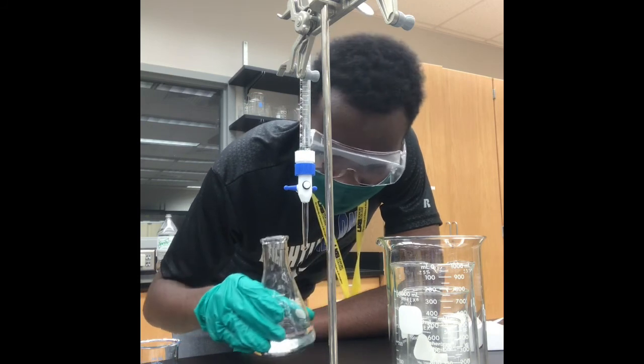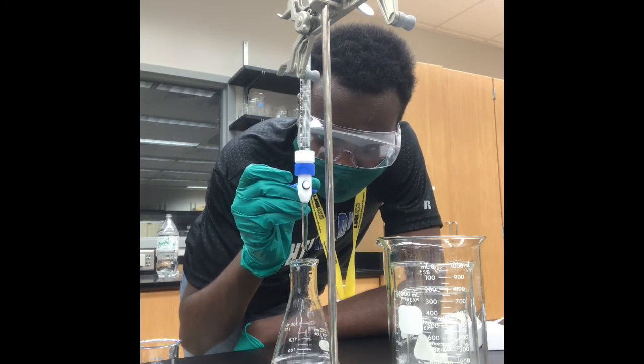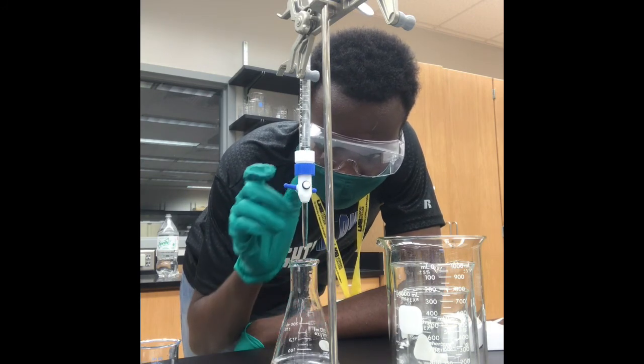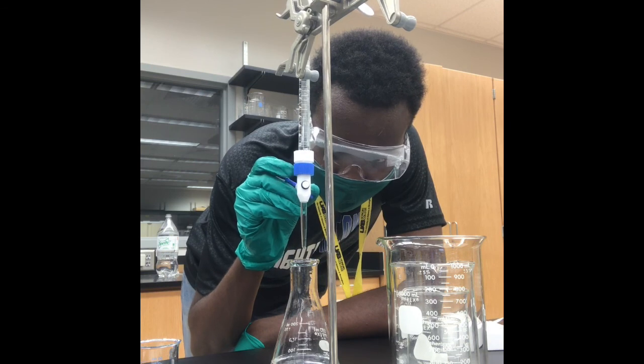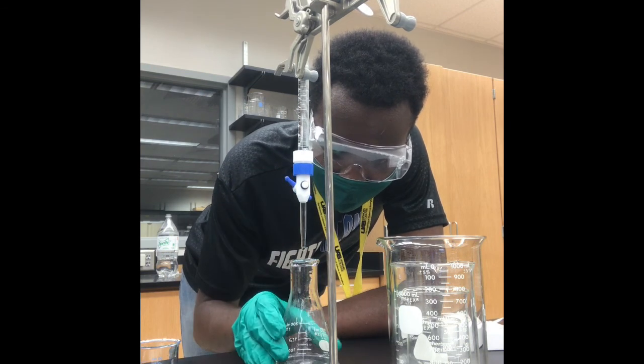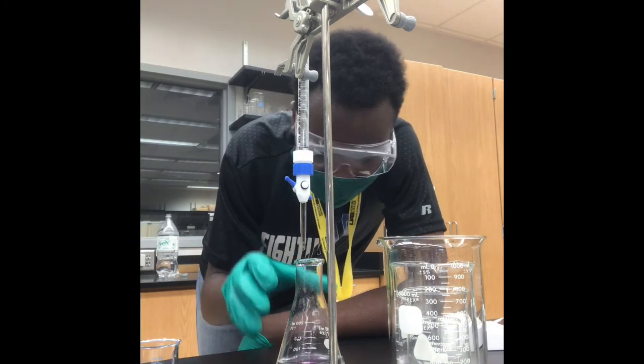And we do this 3 times because you want to get an accurate measurement to determine the unknown concentration of the analyte. The analyte here is sodium hydroxide. We do not know the concentration it has, but we do know the concentration of KHP in 100 milliliters of water because we measured it out in grams.